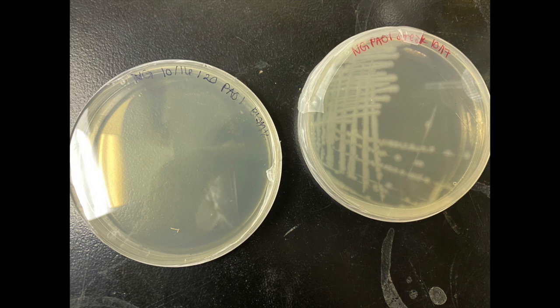While the autoclave is running, make a streak plate of the desired organism. In this case, it is Pseudomonas aeruginosa. After you have created your streak plate, you can leave it to sit in the 37C room to incubate for 24 hours.